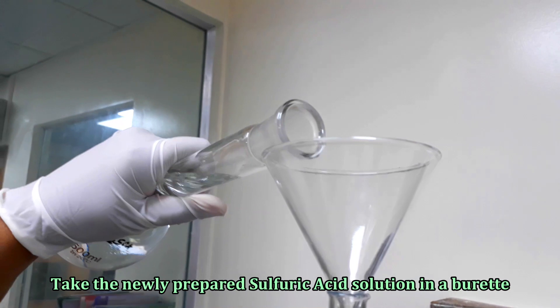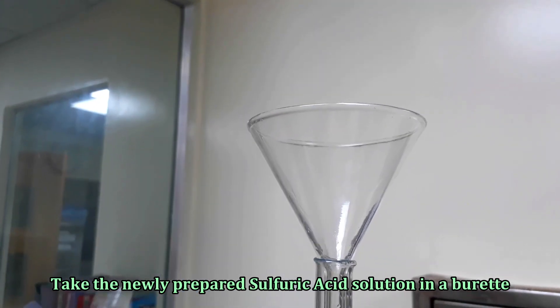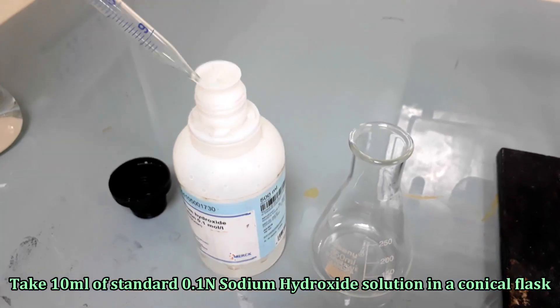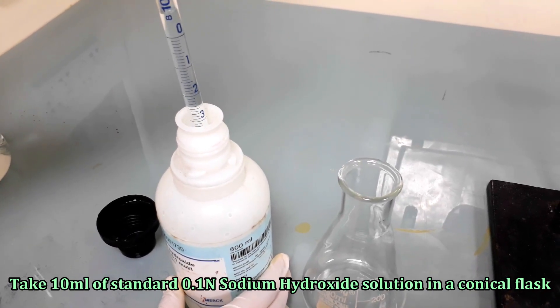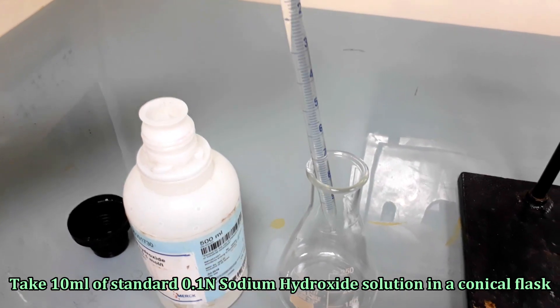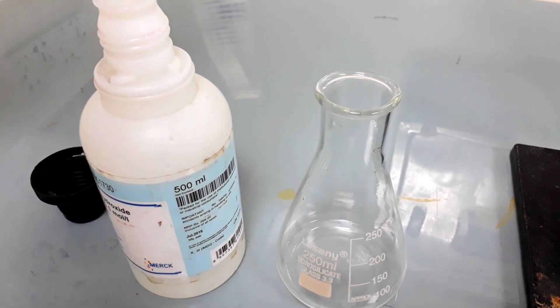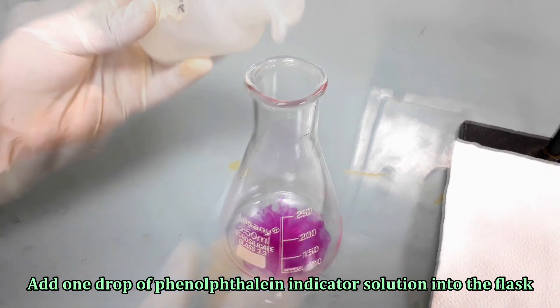For the standardization, take the newly prepared sulfuric acid solution in a burette. Take 10 ml of standard 0.1 normal sodium hydroxide solution in a conical flask. Add one drop of phenolphthalein indicator solution into the flask and swirl to mix the content properly.